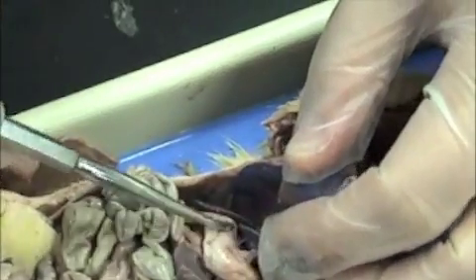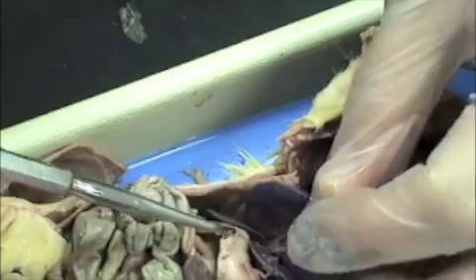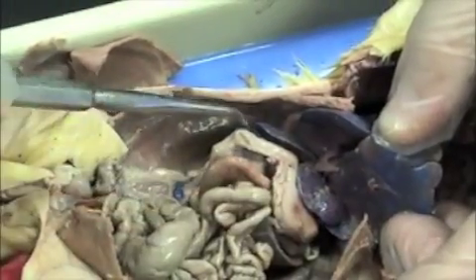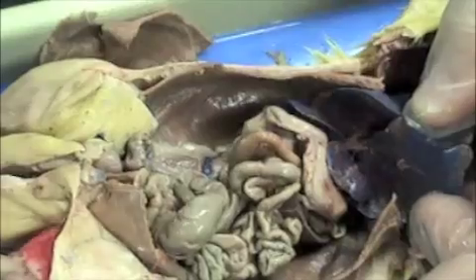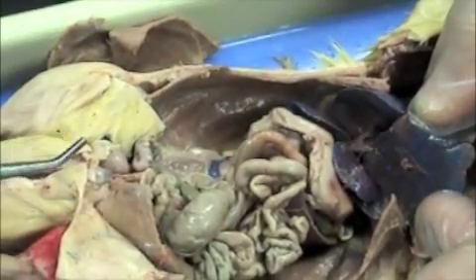The stomach is going to lead to the small intestines. This right here is the small intestine. For this beginning class, to identify the small intestines, you need to look for the stomach — the tube that leads out of the stomach is the small intestines. It does curl around, but for this beginning class, you don't have to worry so much about that.